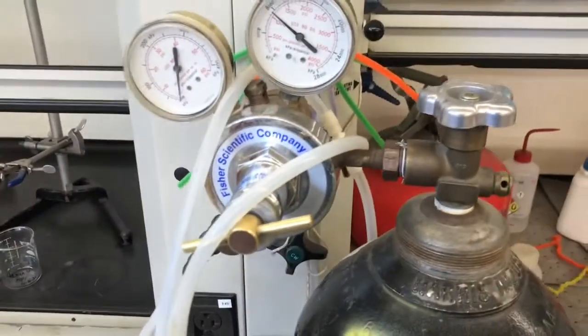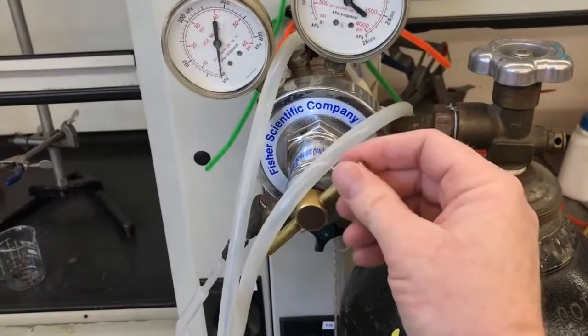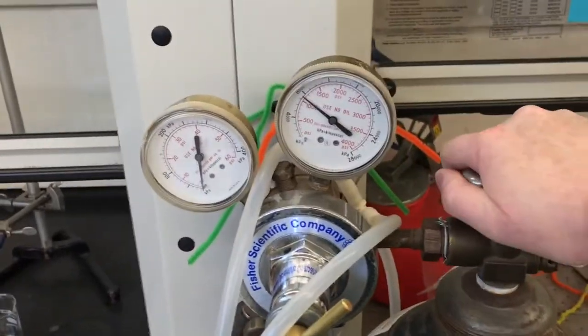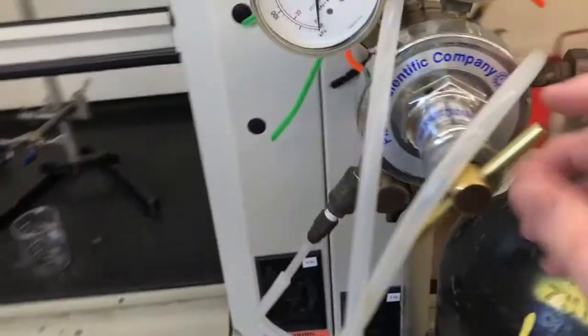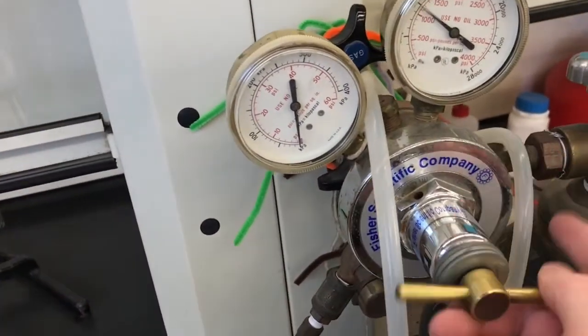But just to make sure they're gone quick enough, I'll do the rich man thing. I'll use the nitrogen tank. So it's currently loose here. It's closed at the top. I'll open it first at the top, and then I'll turn it on here to get a little flow going. Hear it.